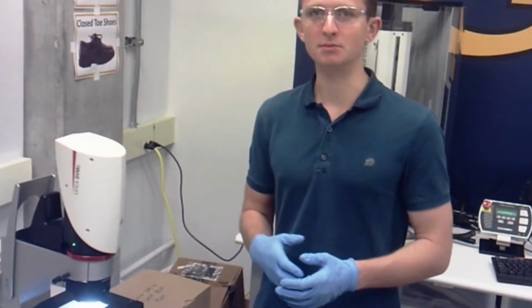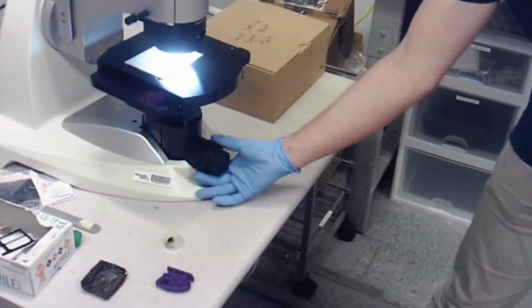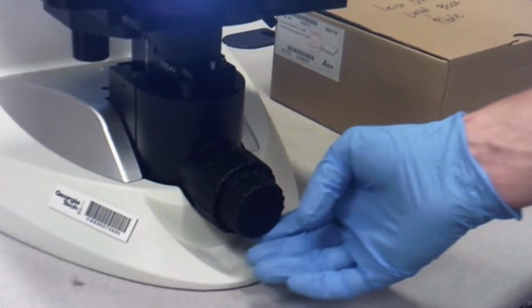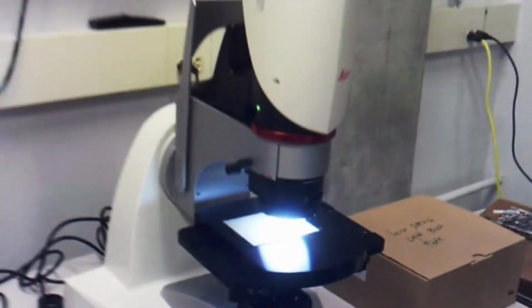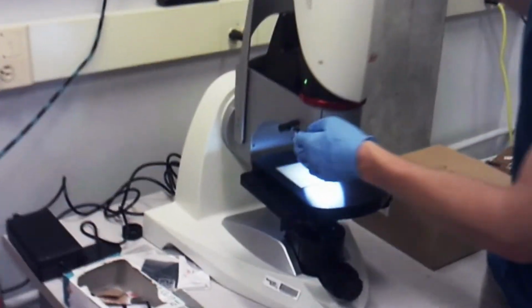Some of these knobs and dials include the coarse and fine focusing dials down here. So there's a coarse dial in the back here, which allows you to make dramatic changes to your focusing. You have a fine dial here, which is used for making slight adjustments to your focusing in an attempt to get your best image. Next, there are the two dials back here.